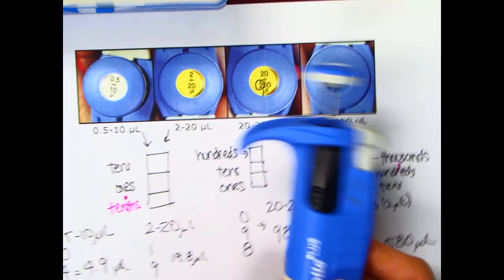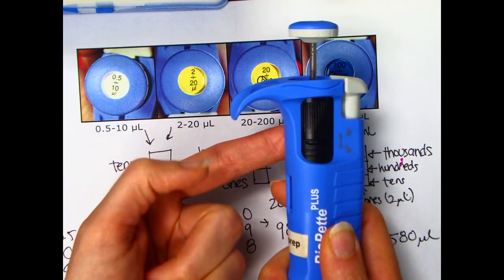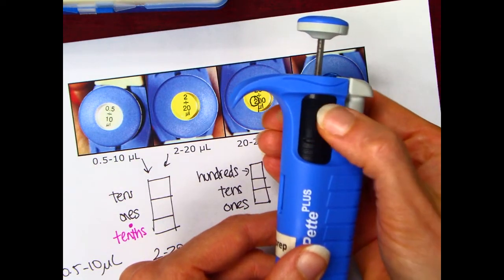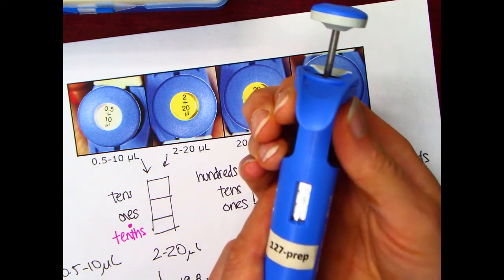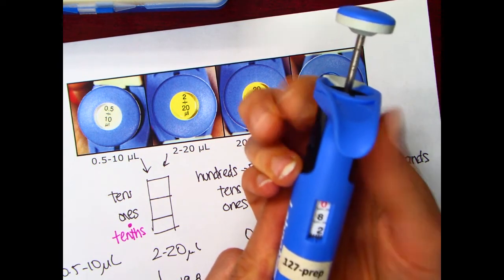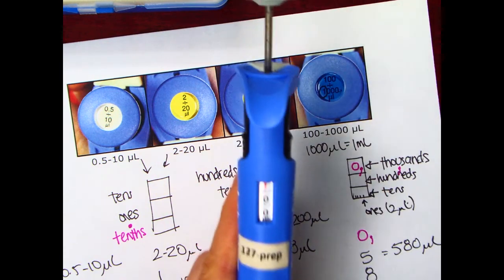The way that we adjust these is they have this sliding lock right here. Do you guys see this moving up and down? That's the lock. It should always be down on yours in order for you to adjust it. And then you turn this top part right here, okay? As I turn it to my right in this particular instance, the numbers go up. Okay, so I'm now at 730 microliters. We're headed to 1,000. 950 microliters. Okay, now I'm at 1,000 microliters, right?